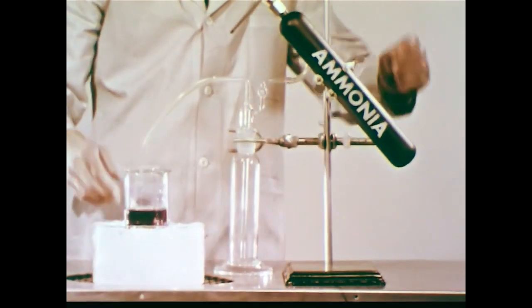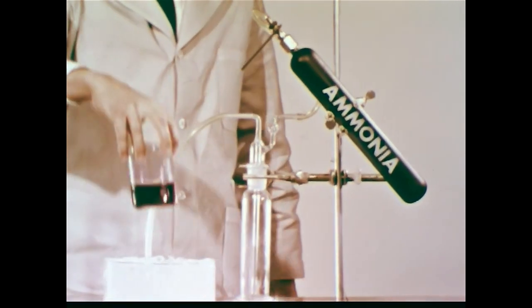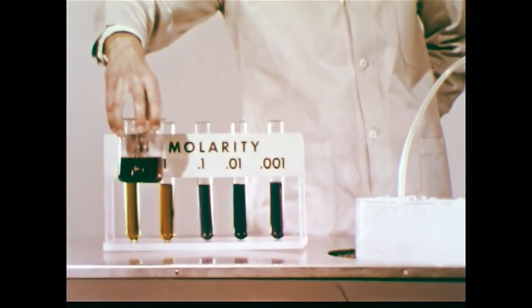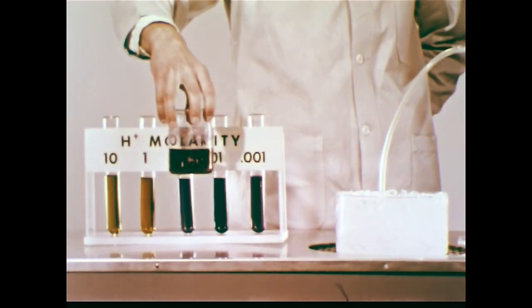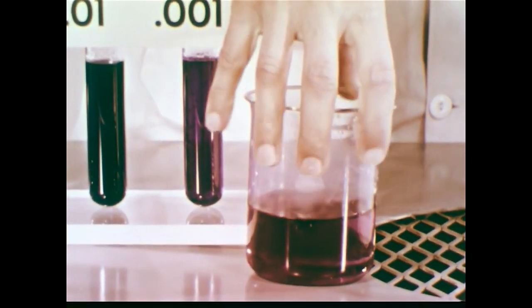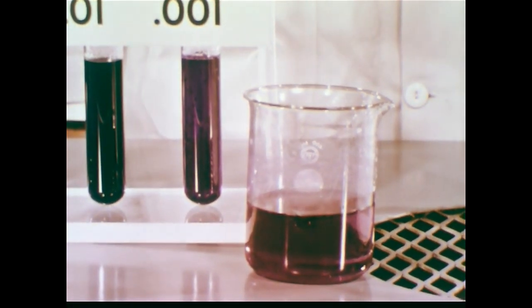Let's compare our product with the known indicator colors. We see that the final solution, ammonium nitrate, has a hydrogen ion concentration of 1/1000th molar or less. Few loosely held protons are present — the acidity is low.